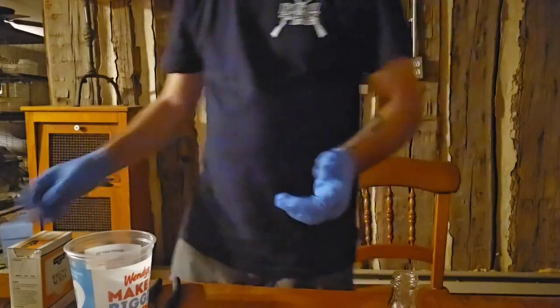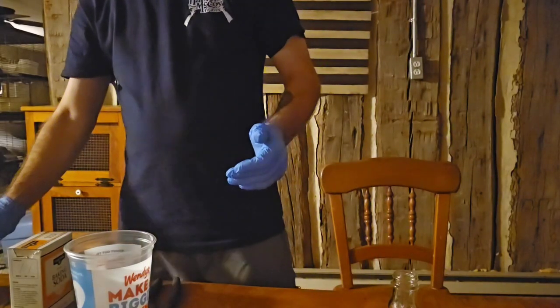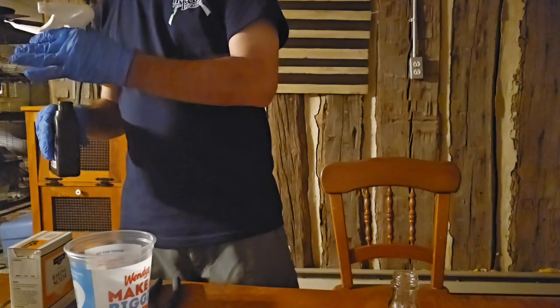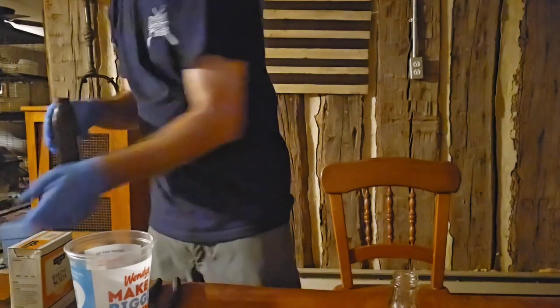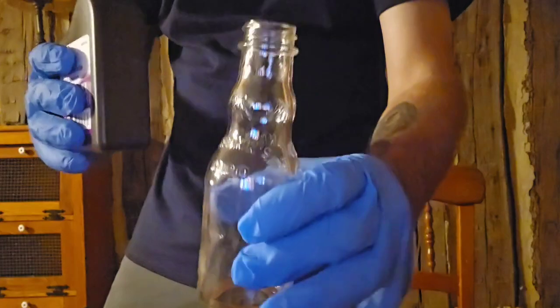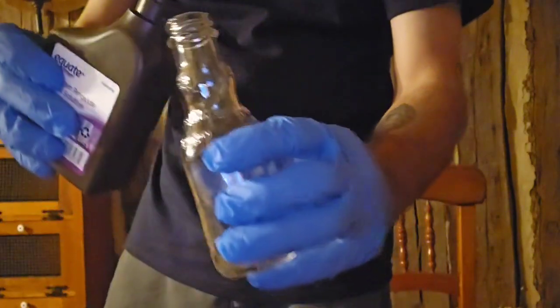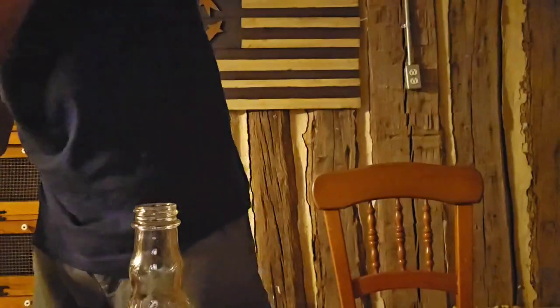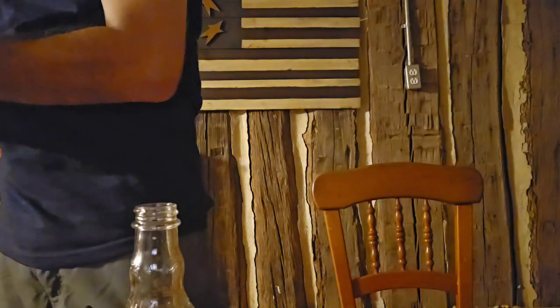Now, what I'm going to do is put a little peroxide in here. Okay, you guys, since this thing's being stubborn, here we go. I got the hydrogen peroxide, and that's what I'm going to put in. I'm going to pour a little bit in there. Okay, let's start that off with that. I don't have to put a whole bunch. I'm just going to put that much in there, okay? Probably more than enough, I would assume. I'm going to go ahead and put that lid back on there. I don't want to spill nothing, you know what I mean?